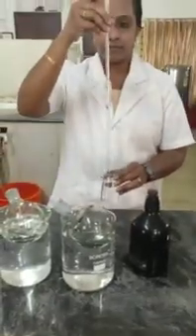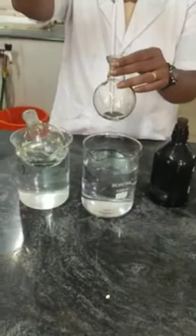Let us start the experiment. Place 20 ml of distilled water in a 500 ml refluxing flask, and add 20 ml of sample into another refluxing flask.